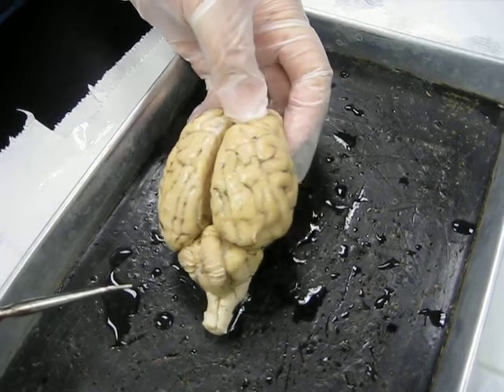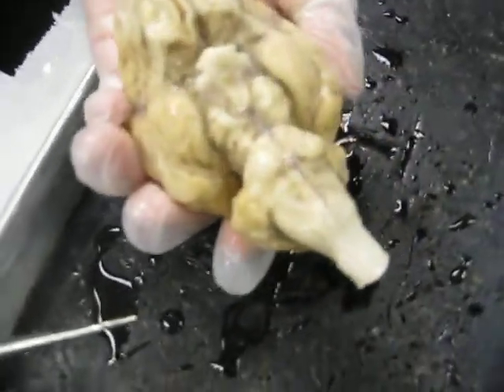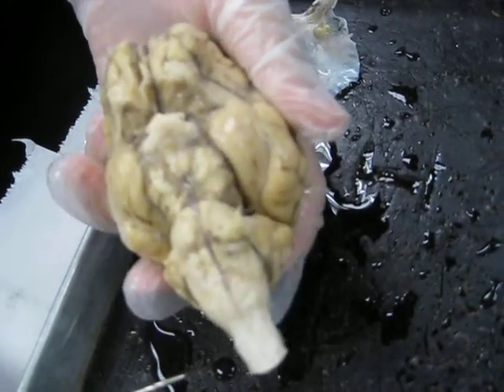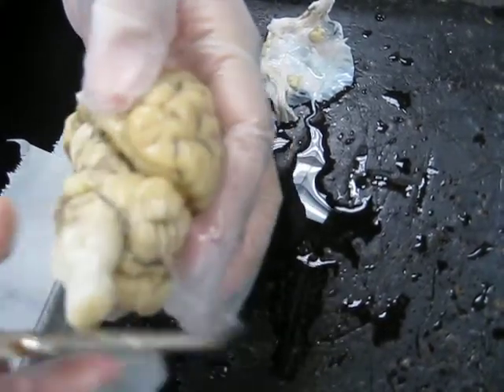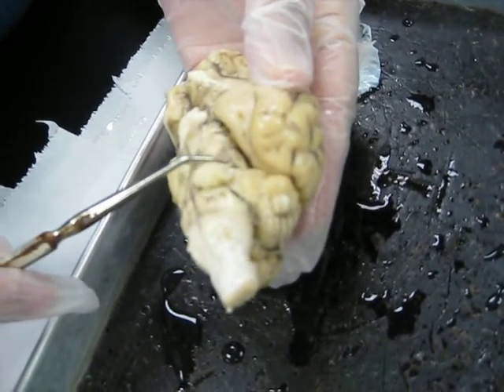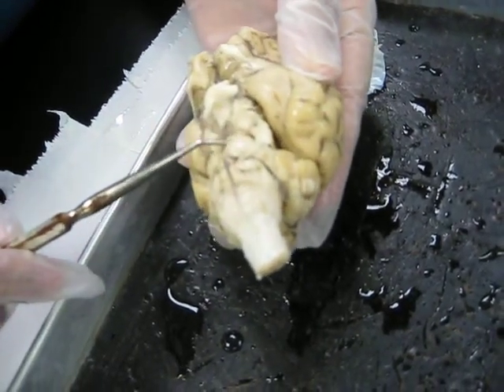In addition, from the outside we can see the pons and the medulla. I'm going to flip the brain over here so that we can see those structures on the lower portion. Looking at an inferior view of the sheep's brain right now. The pons actually at this moment is partially covered by this flap of tissue right here, but these enlargements right here would be the region of the pons. The pons. And just behind it, this other enlarged area right here until it turns into the spinal cord and continues on out, this region would be the medulla oblongata. Medulla oblongata.